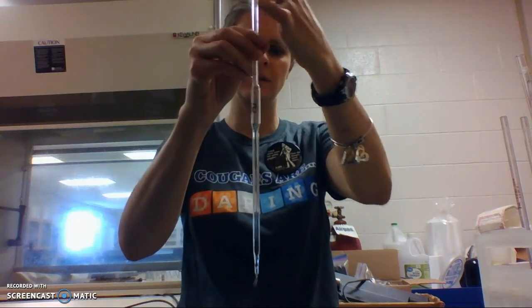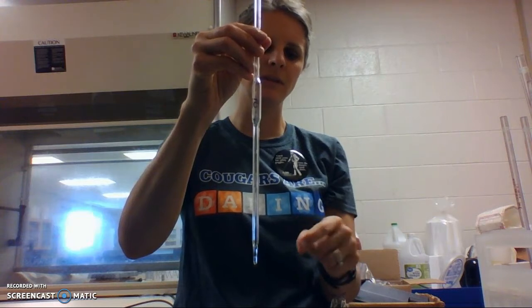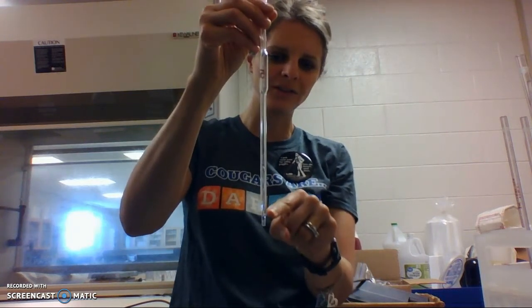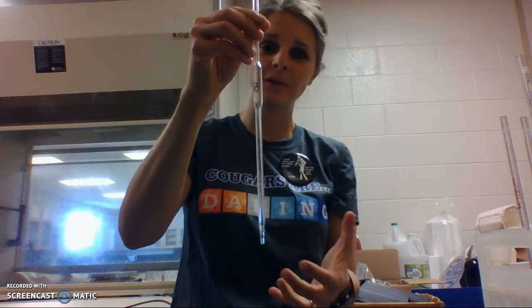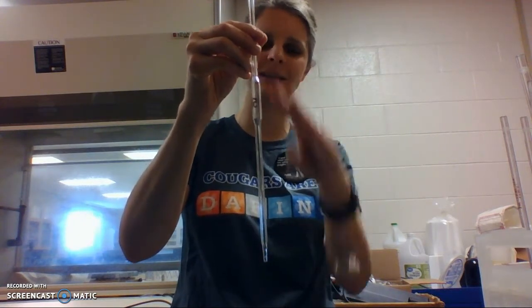I'm not sure if you can see this in the picture. But you can see there's one of my little drops. Let me touch this over here. There's still some water in there. There's still some water in the tip part. It's supposed to stay there. It has delivered for you the 5 milliliters. To deliver means it delivered it.